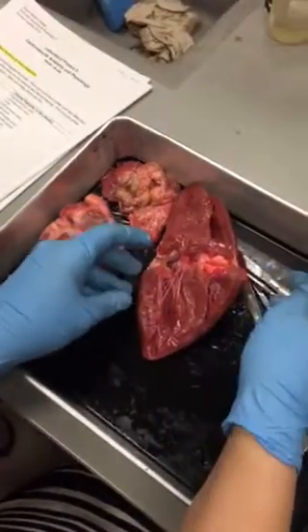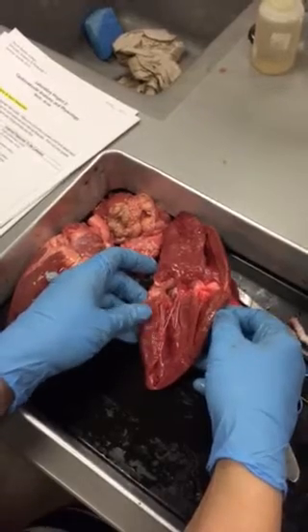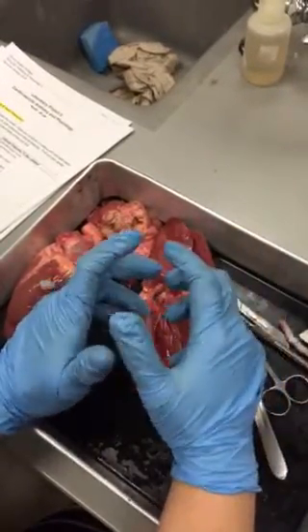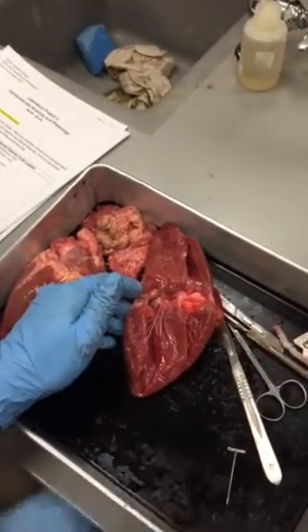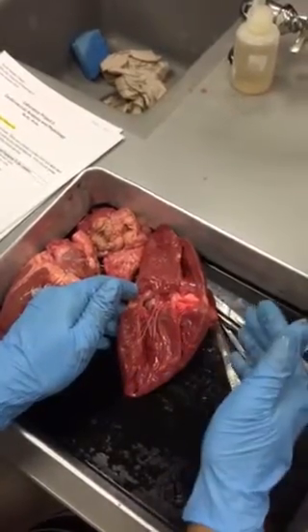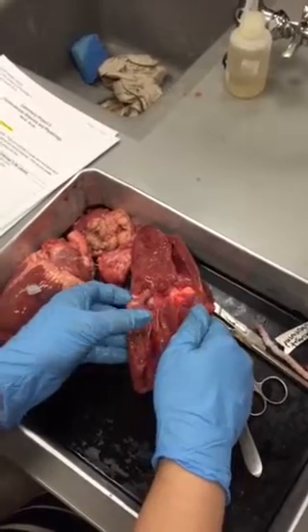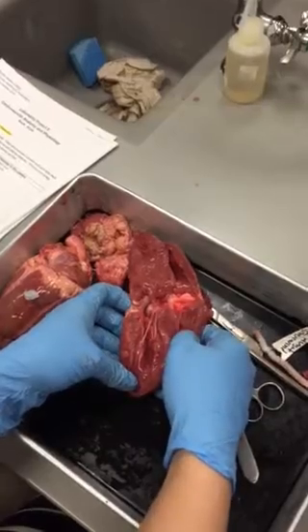So when you're looking at these chambers, you can tell right away that you have a muscular wall that is very, very thick on one side and it's much thinner on the other side. Okay? The reason for this is that one side of the heart is responsible for pumping blood into the systemic circulation, so that means it has to pump blood to the entire body. The other side is only responsible for pumping blood into the lungs, so it's not going to need as thick of muscle. So which side is going to pump to the systemic circulation? The left, right? So this is going to be your left ventricle and this is your right ventricle, okay?